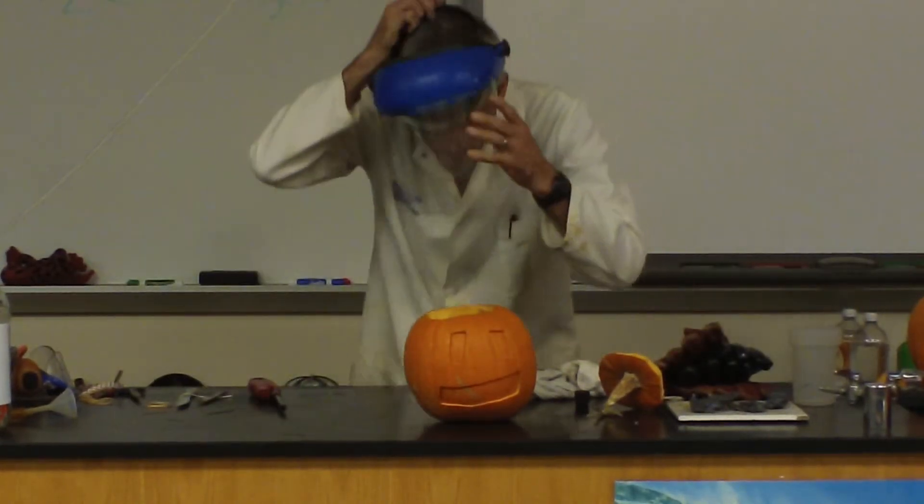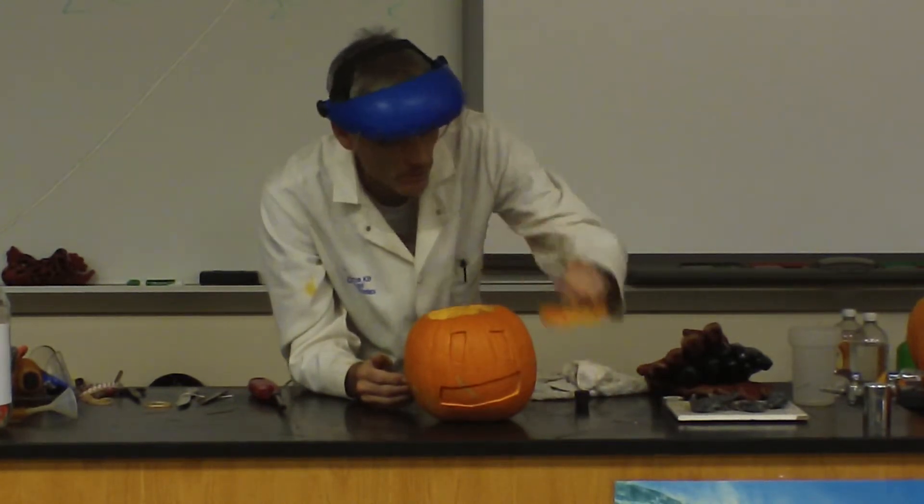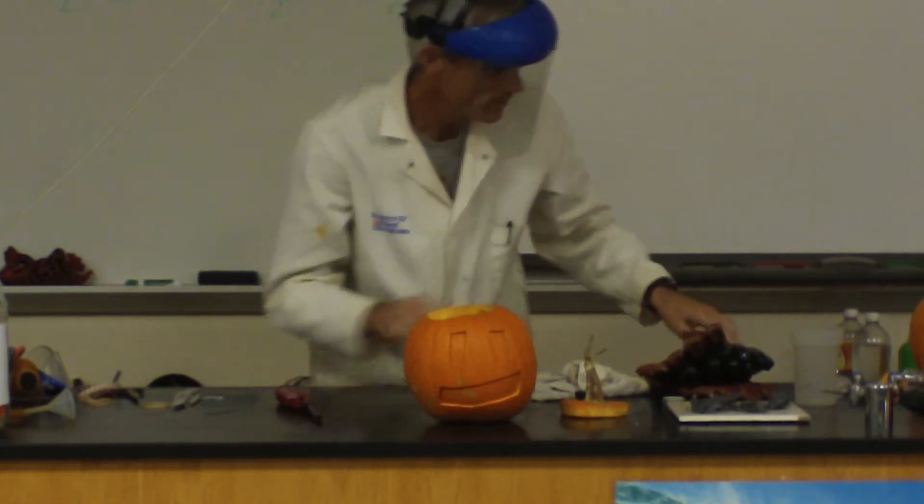Now, I'm going to wear a safety shield on my face just in case something weird happens — protect my eyes and my face. And make sure this plug goes in the way I want it, so that's the orientation I want. Got my lighter, and it works. Let's generate some acetylene.